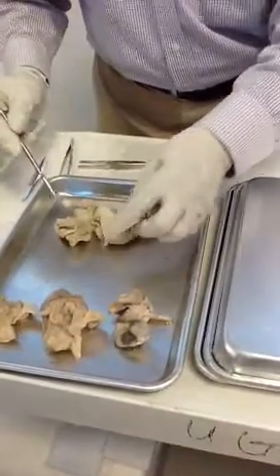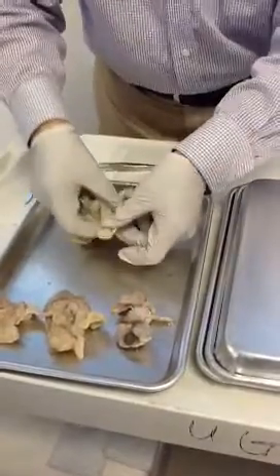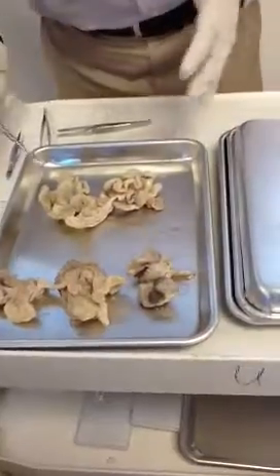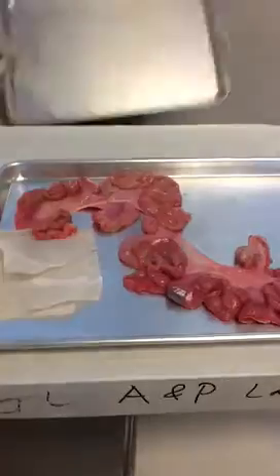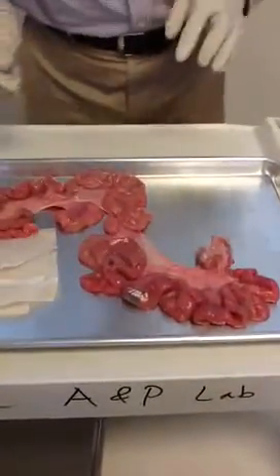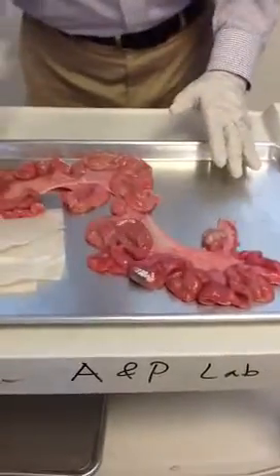But today I'm very lucky. I just have to bend it so we can have a good picture. Another one — I was lucky to get a fresh one. You can smell it a little bit, but I think I like it. The fresh one is completely different from the older ones.